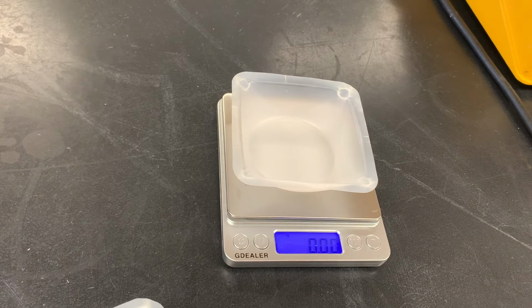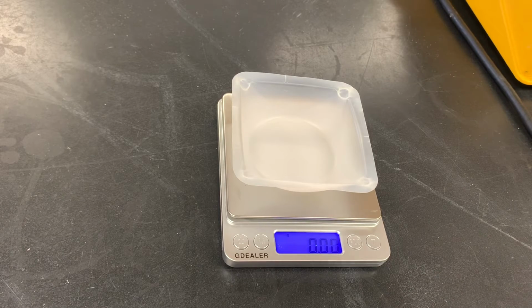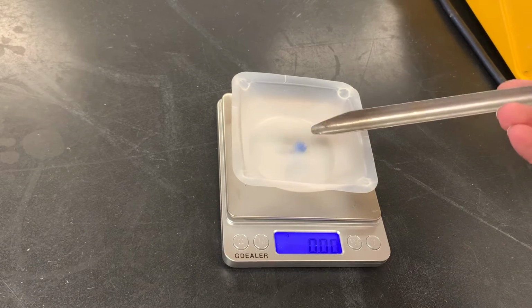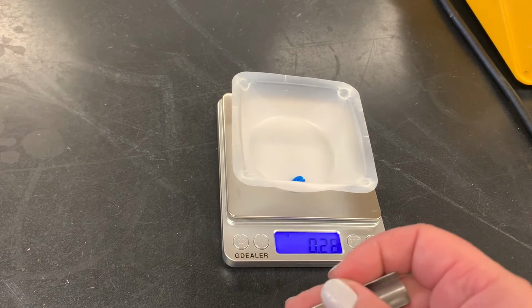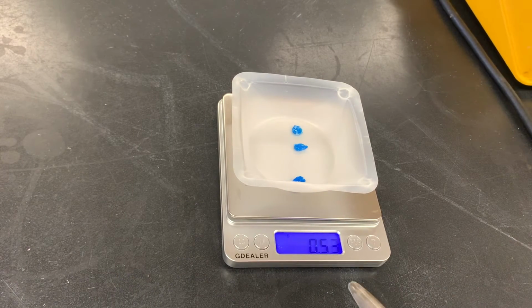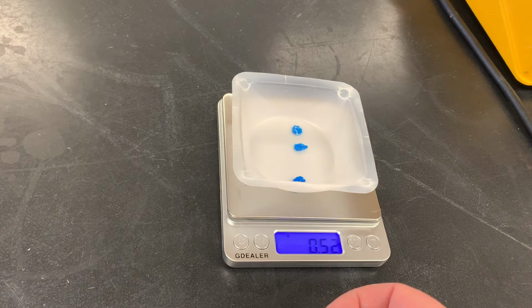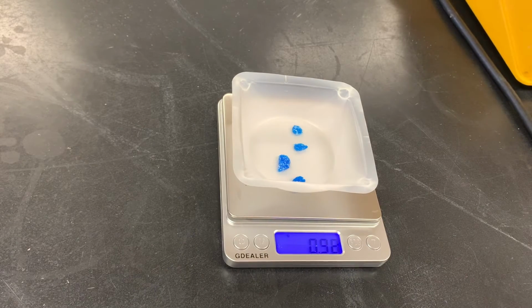So in this case, I'm going to transfer them from this weigh boat where I've just pulled some out of the bottle, to make it a little bit easier to get into our weigh boat that's on the balance. And I'm looking for those numbers here to hit 1.0. So taking a mass, we've got to be exact here. I don't just want something close to 1.0.